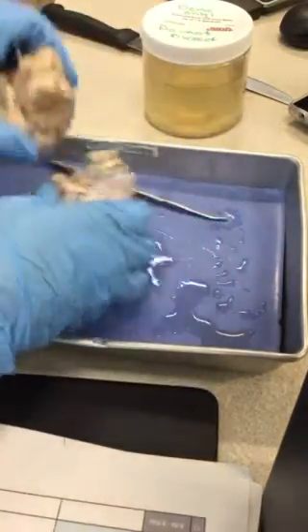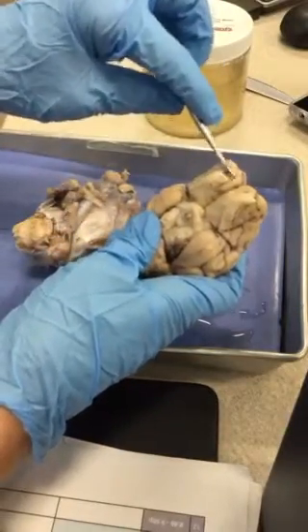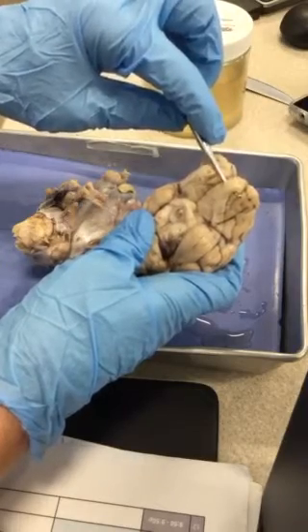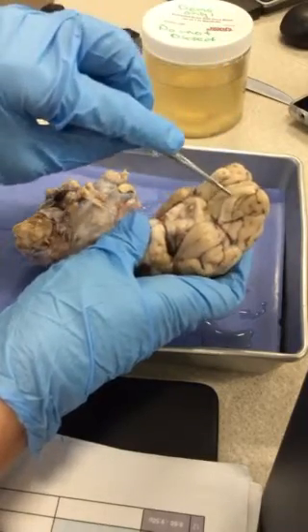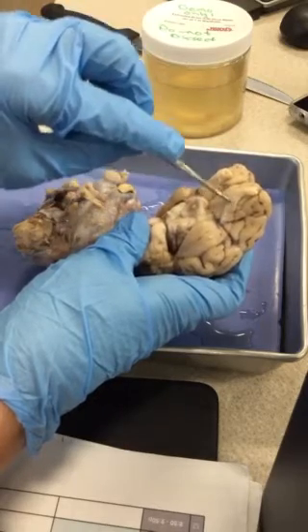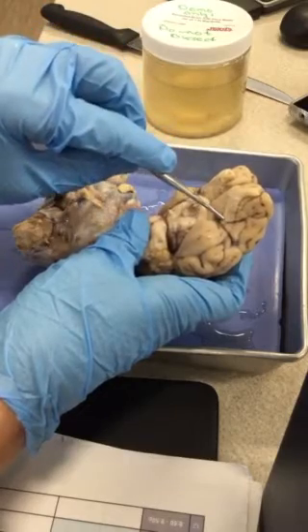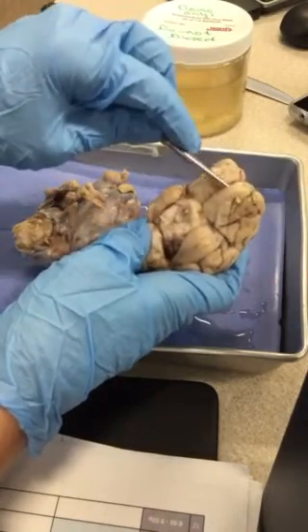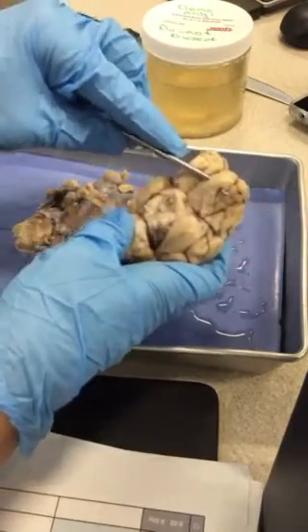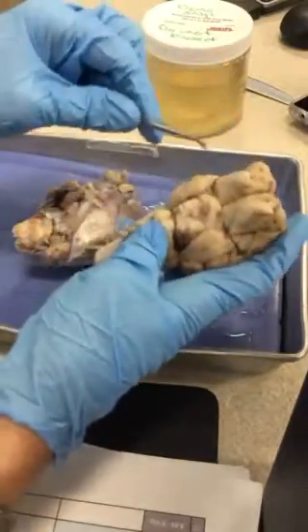Some of the sheep brains are, like this one, totally removed, but this one, I can see there's a little bit of remainder. So then those swellings, remember, continue on into the brain as the olfactory tract. So this lighter portion here is the olfactory tract, ending again in the olfactory bulb. Can you see that okay up there? Okay. All right, then we have the optic nerve.